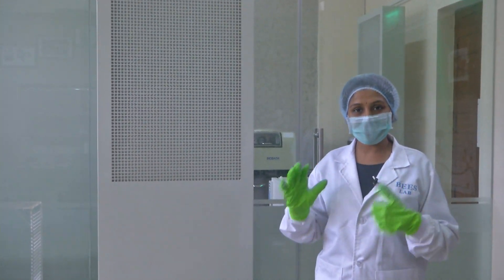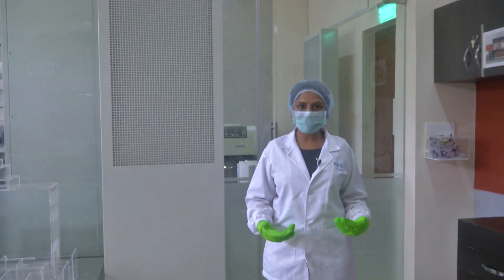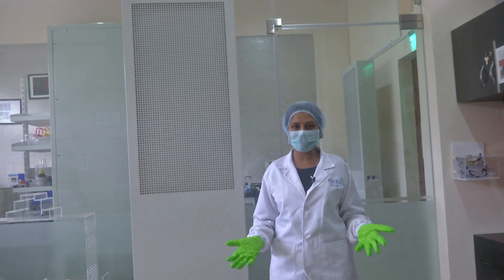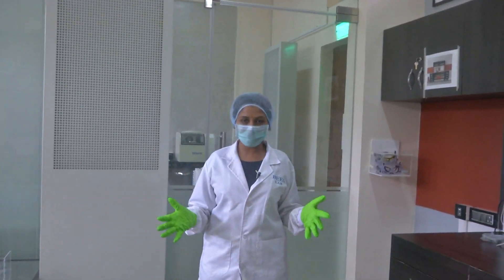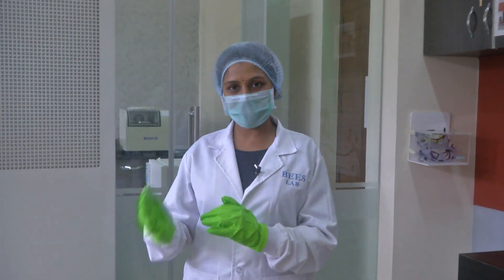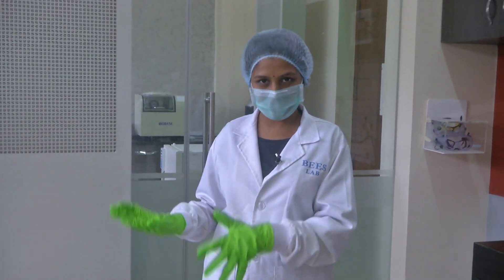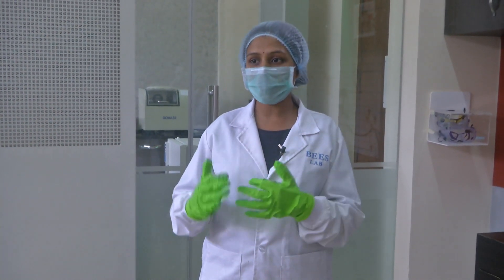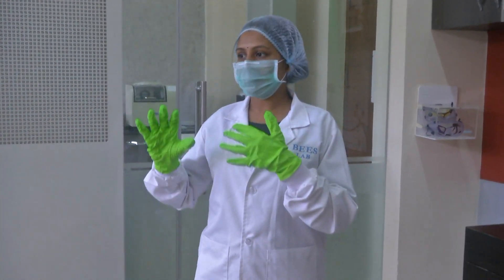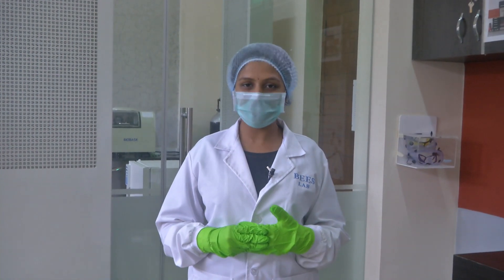In order to save your devices and maintain better efficiency and filter lifetime, always do your best to maintain the clean room to the given standards. This was a brief introduction to how we work in a class 10,000 clean room and how the gowning procedure is to be followed. In the coming modules, we will cover the different equipment available in the facility, why they are used, how they can be handled, and what characterization can be done using the tools.